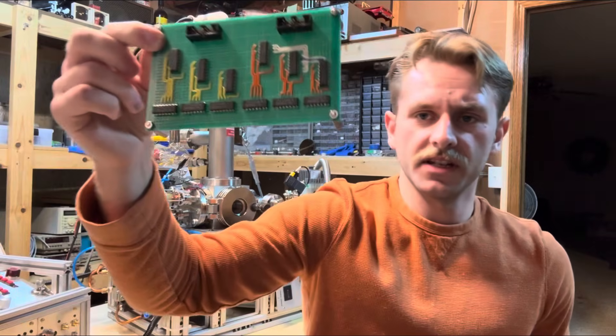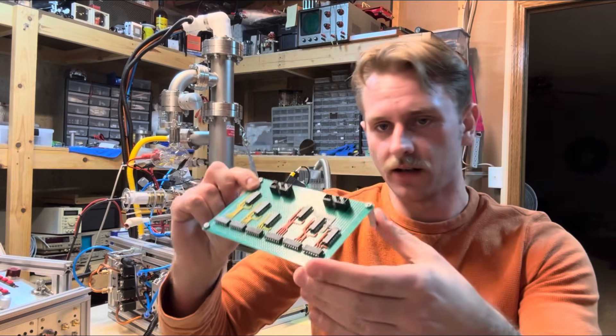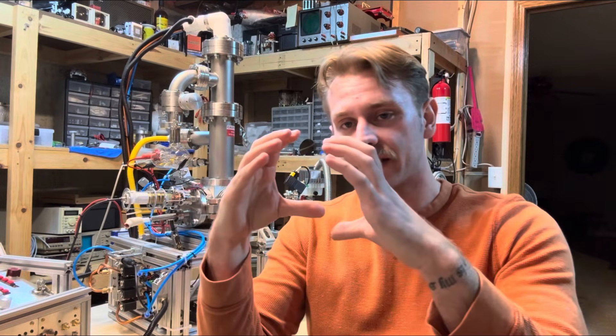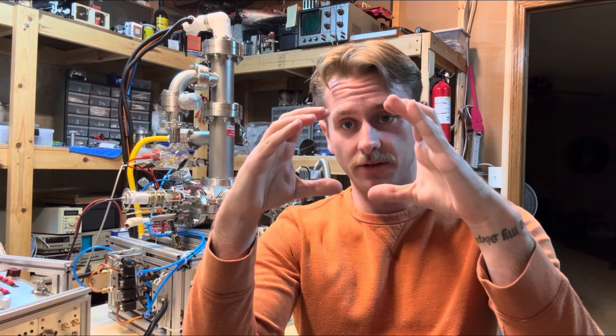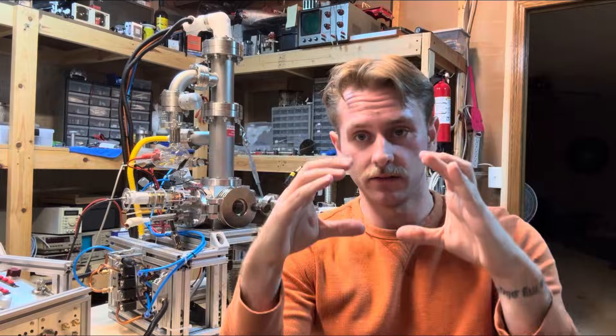That board is most of the way completed, and it's got some auxiliary boards like this one here too. This is going to handle the actual position of where I'm scanning. So I can move, like this is my screen, what's going to be on the screen. I can move this as well. I can do it analog with the actual amplifier, and then I can do it with that circuit as well.